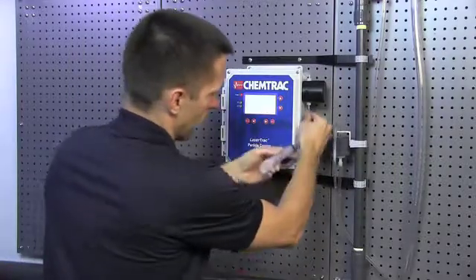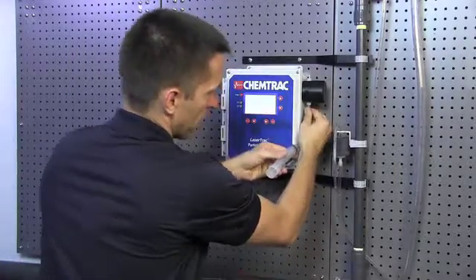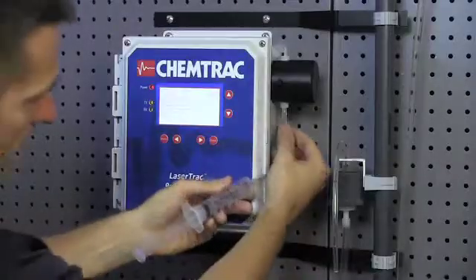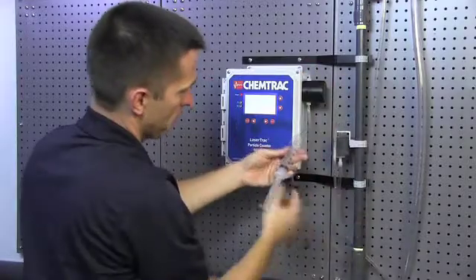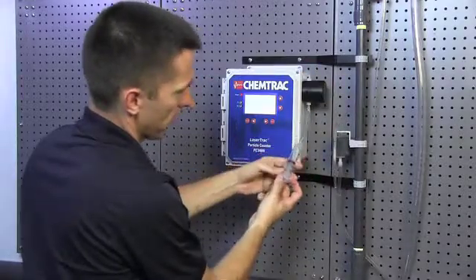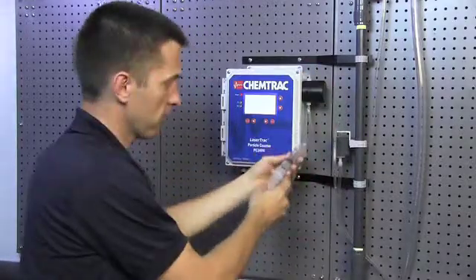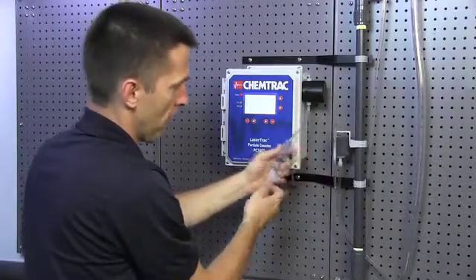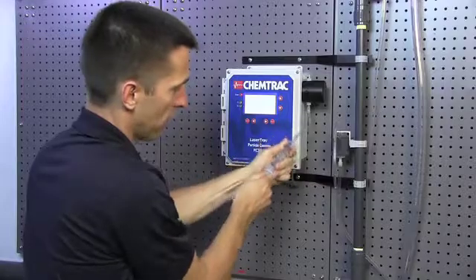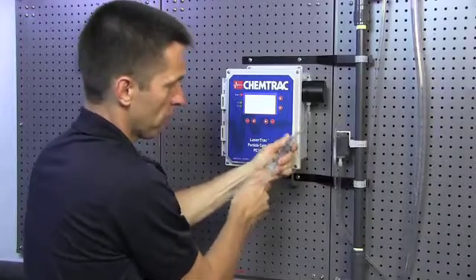You don't want to take a chance of damaging the sensor by letting an aggressive cleaner sit in there too long. Simply attach the syringe to the bottom of the sensor and then you can attach another piece of tubing off the top of the sensor to a drain. Then inject your cleaner and just let it sit for some time so that it does additional cleaning to the sensor. You can actually even rapidly move the syringe back and forth which can help give the sensor additional cleaning.